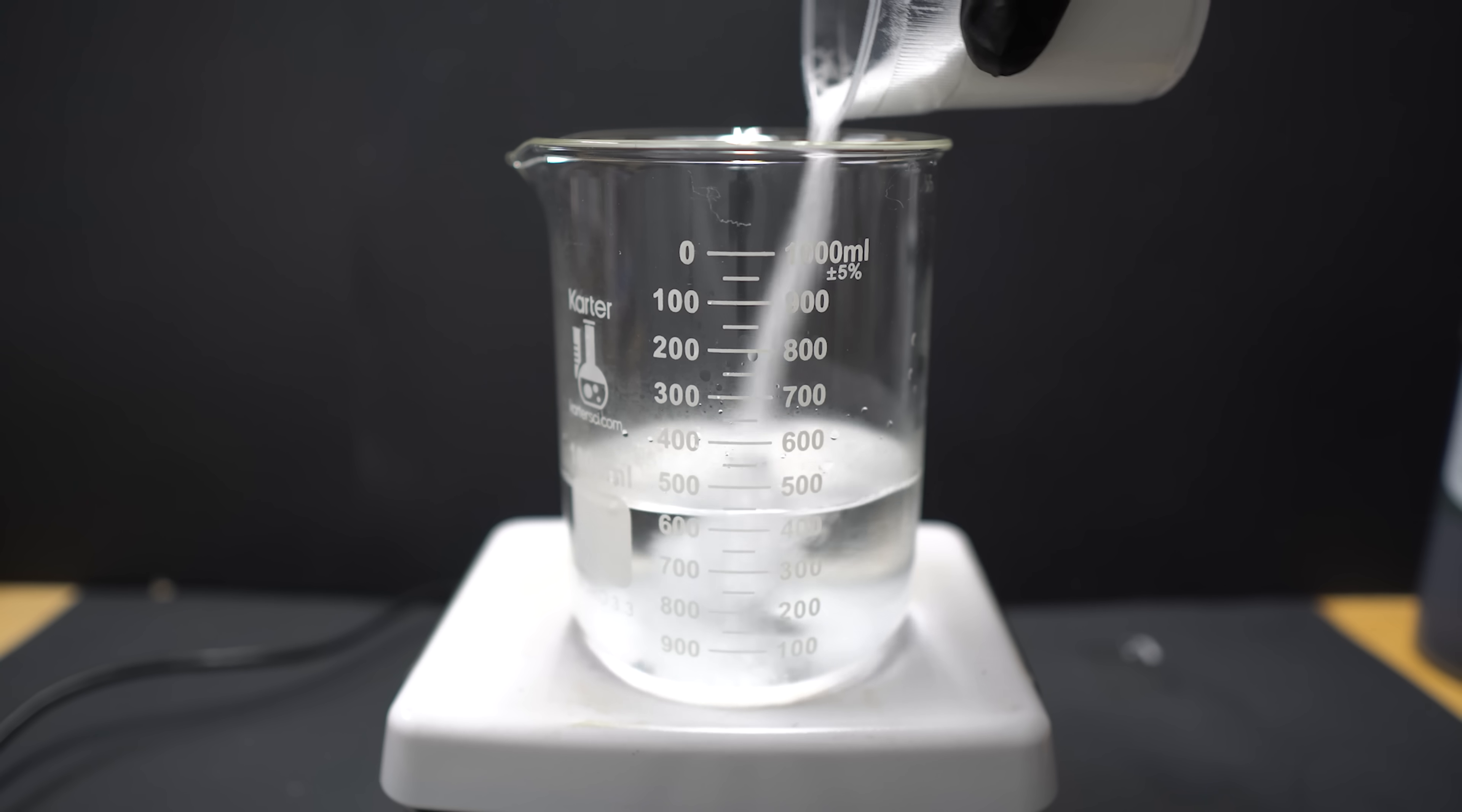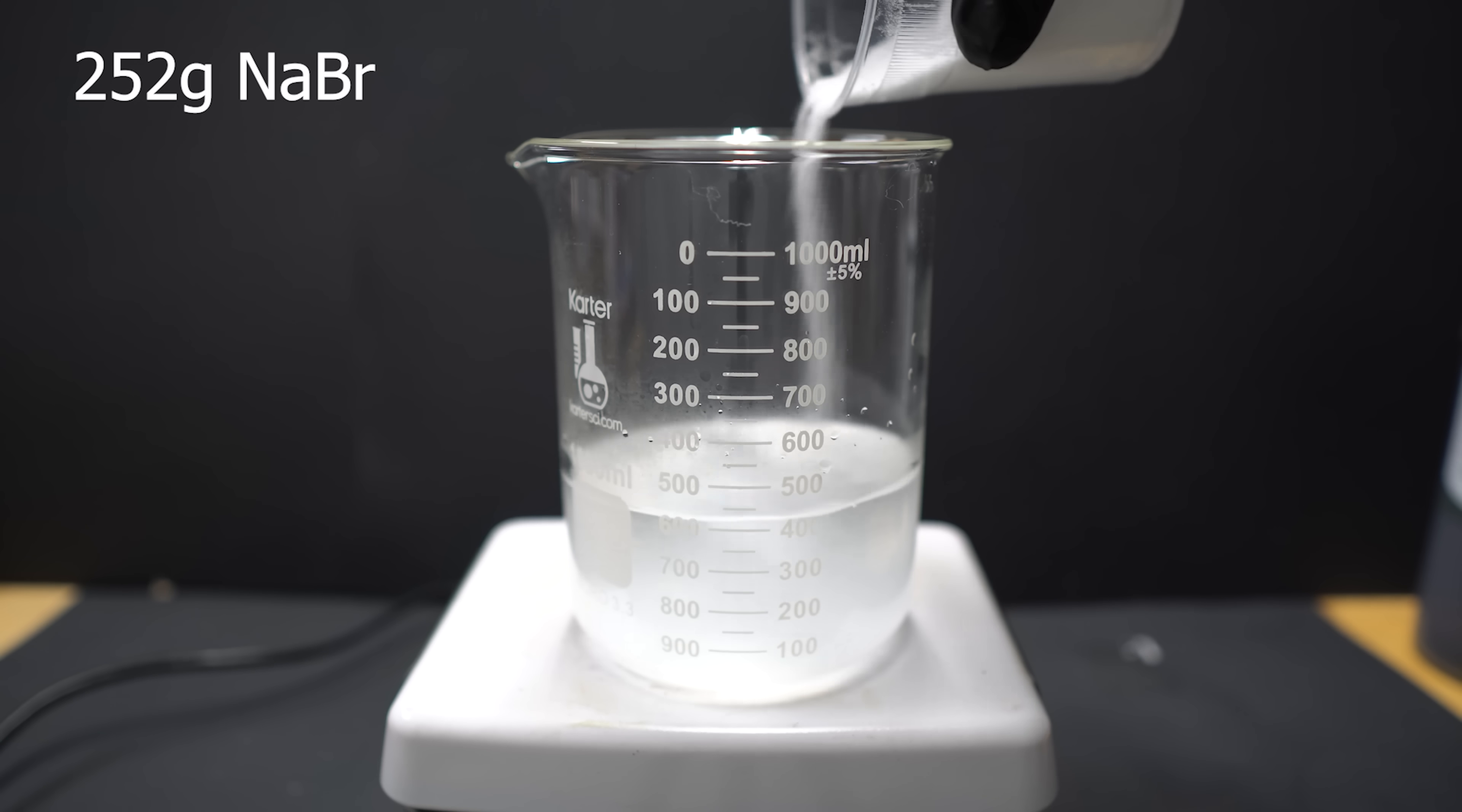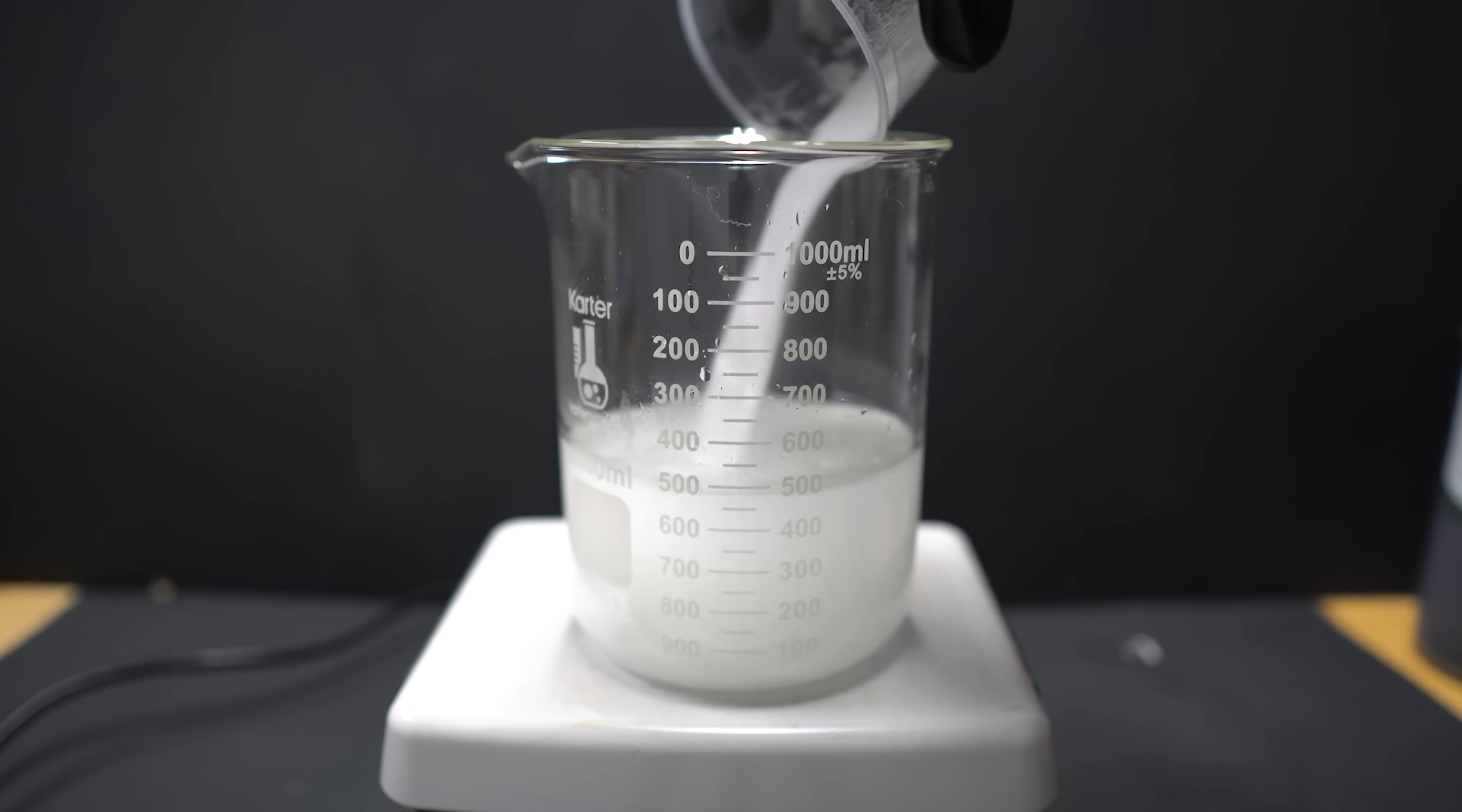250 grams of sodium bromide is going to be put in. Now, I actually used about 252, which I will calculate the percent yields and adjustment of that. However, 250 grams is perfectly reasonable.